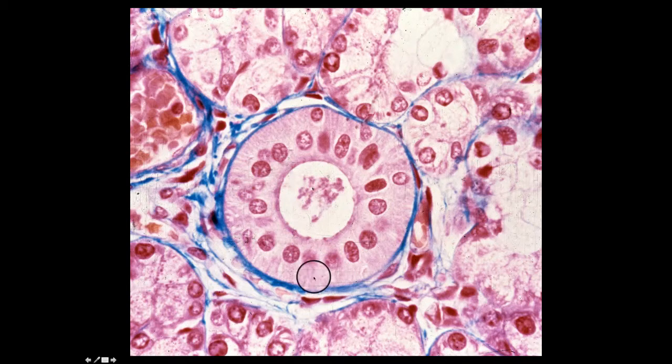This is an area where there's membrane infoldings with a lot of interdigitated mitochondria, and once again this would reflect active transport, and in these large salivary glands, these striated ducts function to concentrate the secretion of the salivary gland. We'll have more to say about that later in the course. And again, a trichrome stained slide, so the blue is picking up connective tissue.